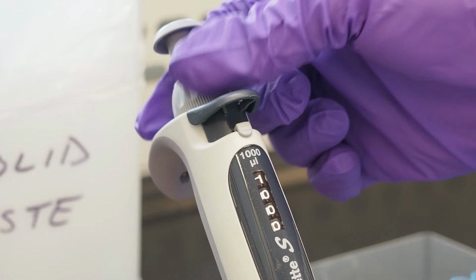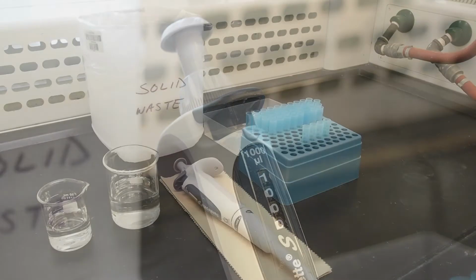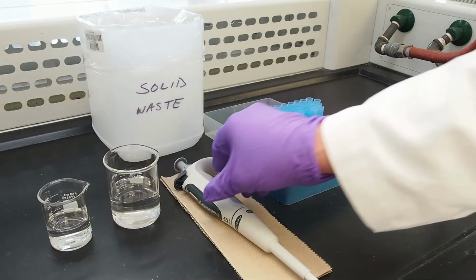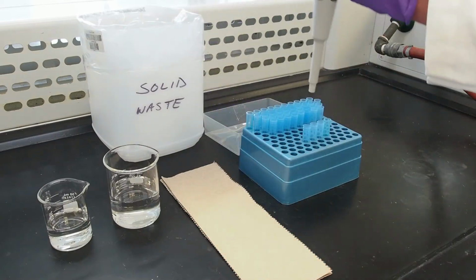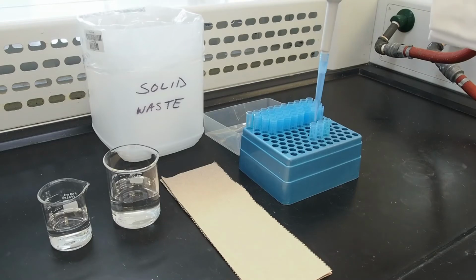After adjusting the volume, relock the volume wheel and then attach a tip to the pipette by pressing the pipette shaft into the opening of the tip with light pressure until some light resistance is felt. The tip should be firmly attached and should not wobble or wiggle, but do not jam the pipette into the tip, as this may also damage the pipette or lead to inaccurate transfers.